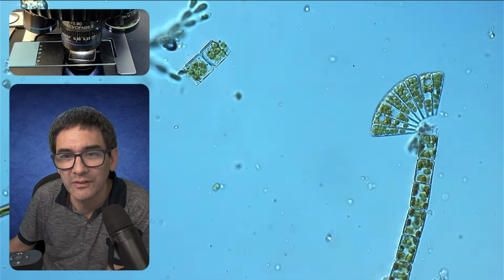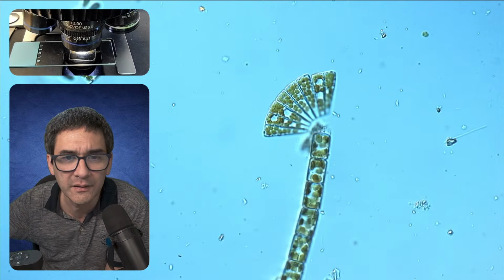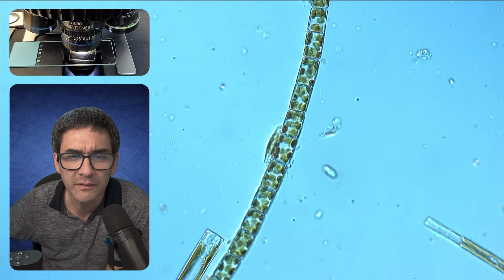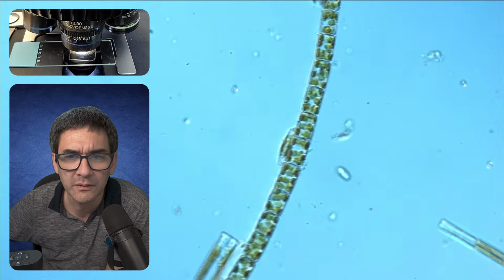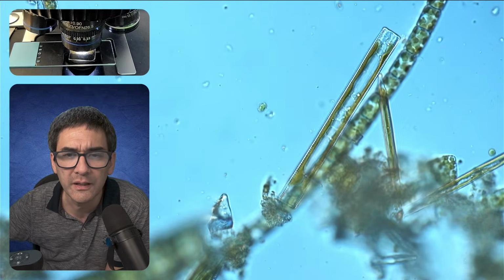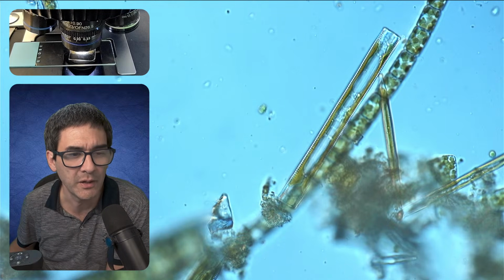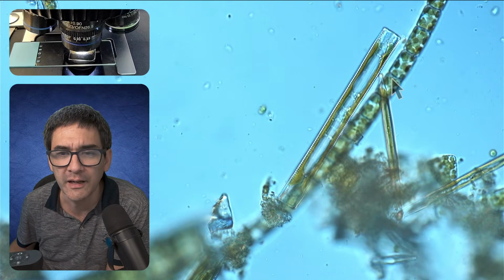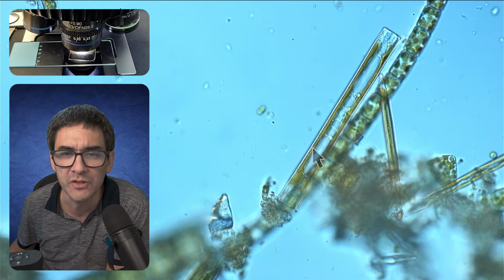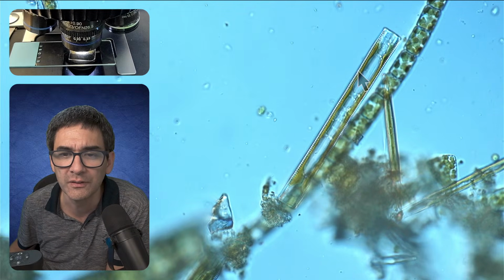Look at those here. Yeah, this is actually quite nice looking. And there are a whole bunch of diatoms here as well. And if you have a microscope, you can also do a little resolution test. There are actually some microscope slides out there that have diatom cell walls, and if you're able to see those details here, this tells you something about the resolution of the microscope objective. Those tiny little patterns here.